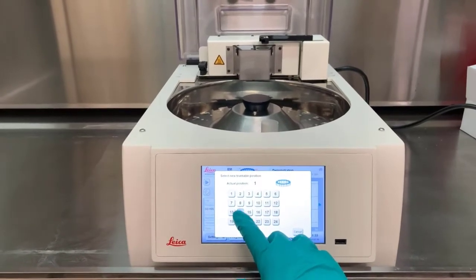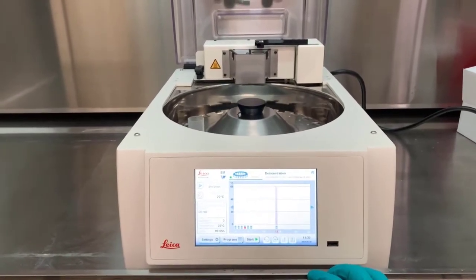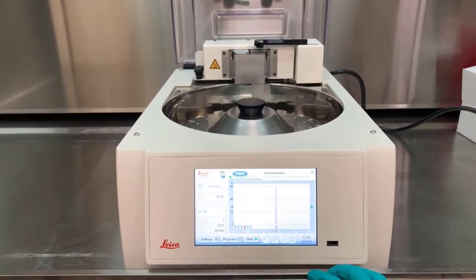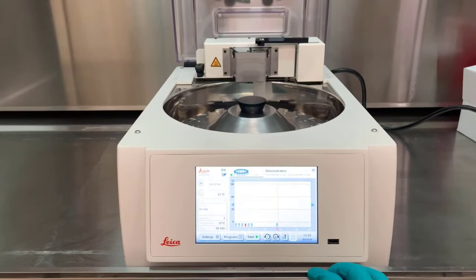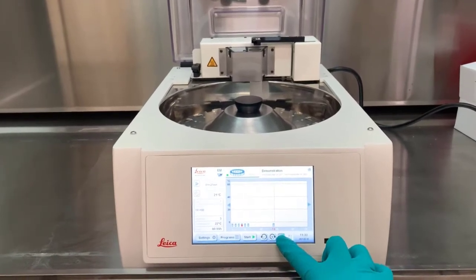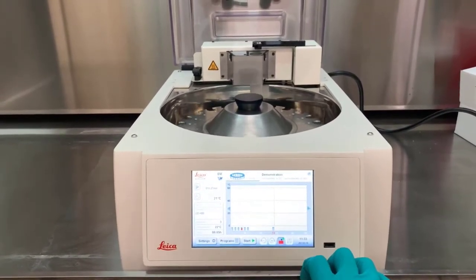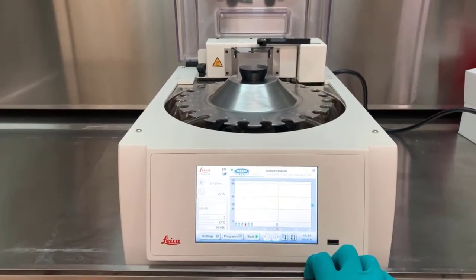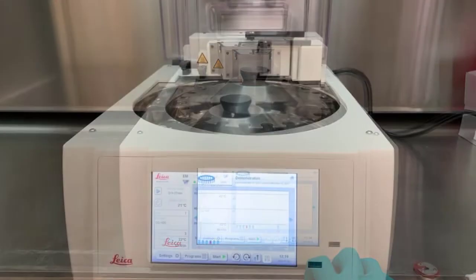If a particular vial for a temporary step is required, that can be adjusted manually. While programs allow stepping through manually, it is recommended to use a created program for an overall protocol.